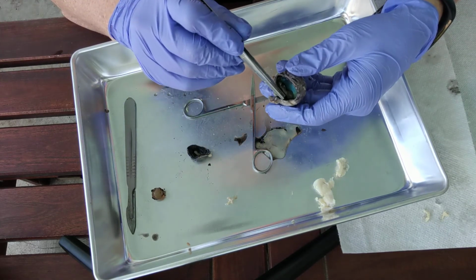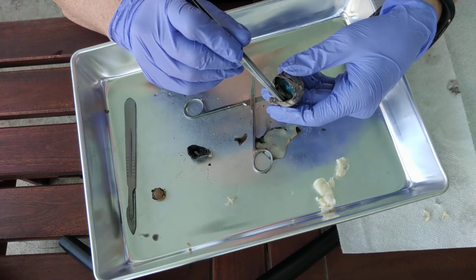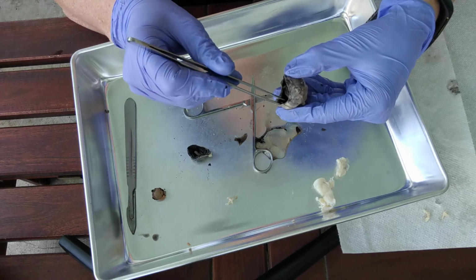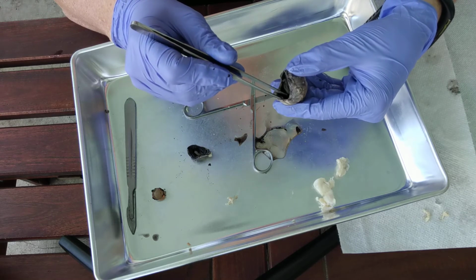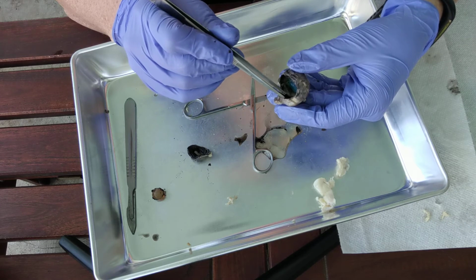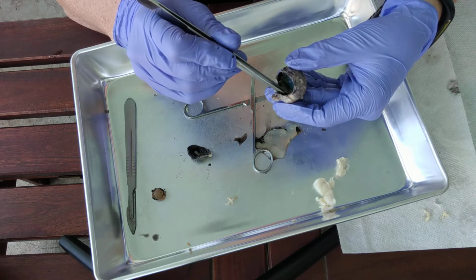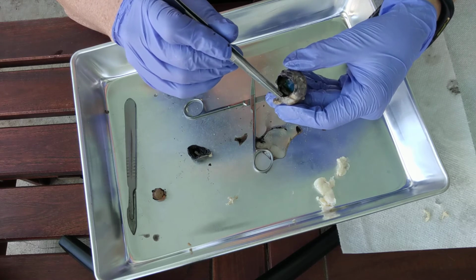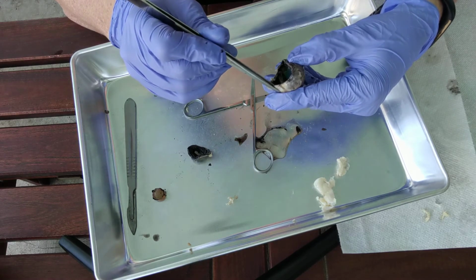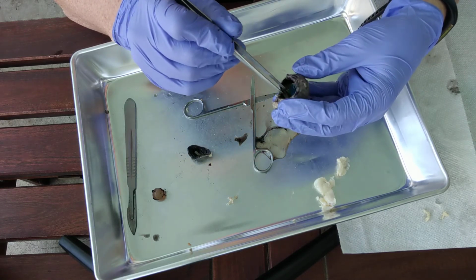Okie dokie, and so the neural layer would be the retina, the next would be the choroid, and in humans the choroid is going to be nice and dark. This is the vascular layer, where you have blood vessels that are going to nourish the other cells. Okay, there's the choroid. And then the tough outermost layer that protects it and produces the shape and structure, that's going to be the sclera.